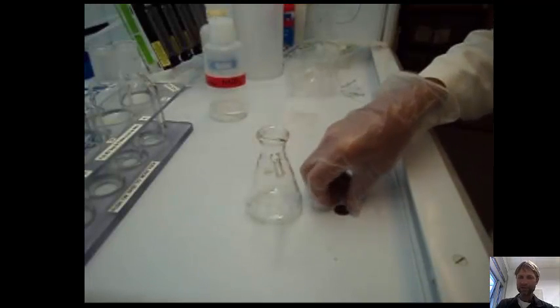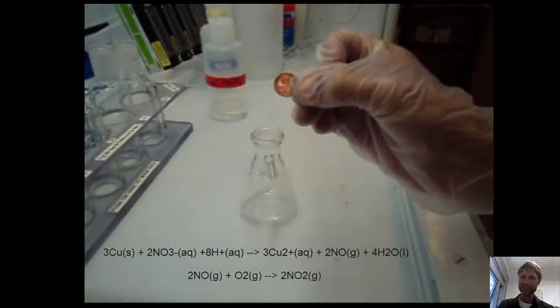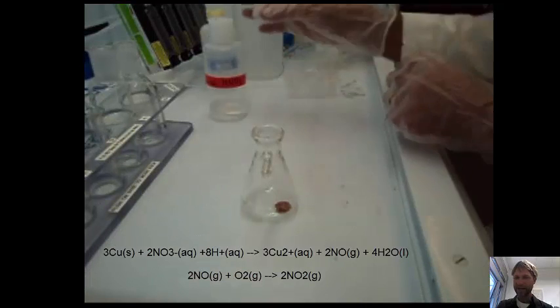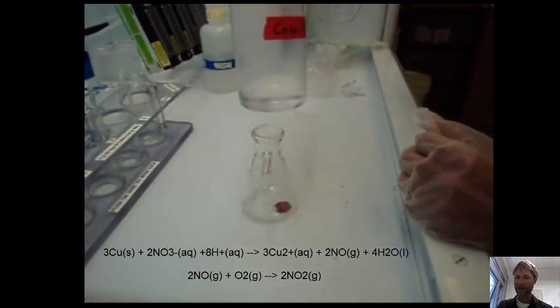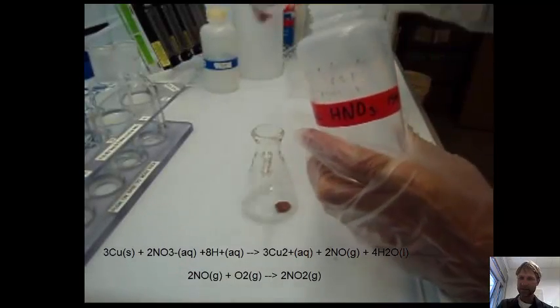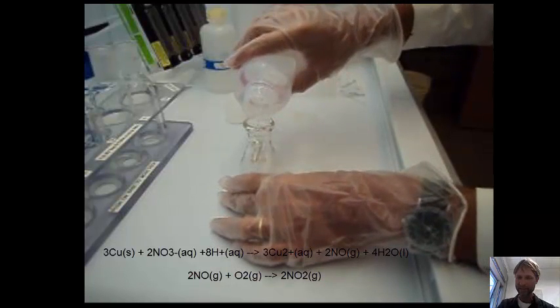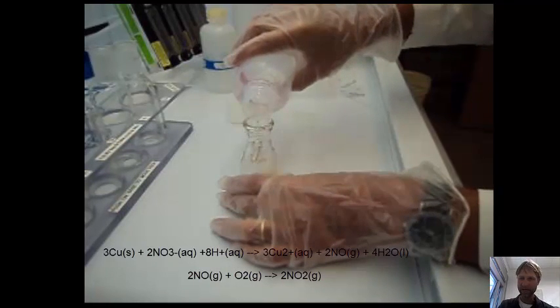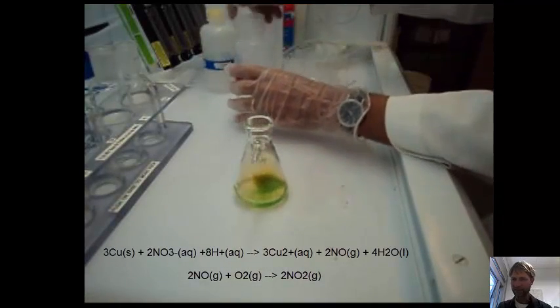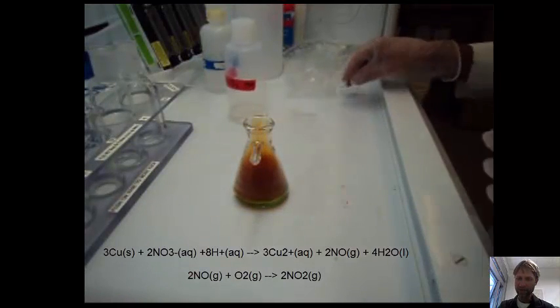Okay, so now we're going to look at a reaction that I did in the laboratory, and this is in a fume hood because it gives off a very noxious gas called NO. I'm going to react a penny, which has copper in it. The reaction is copper plus concentrated nitric acid, which is 15 molar nitric acid. So copper plus nitric acid gives you copper 2+. The copper is going to dissolve. The penny will dissolve, and it produces NO.